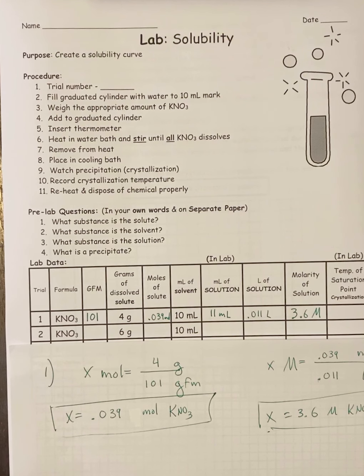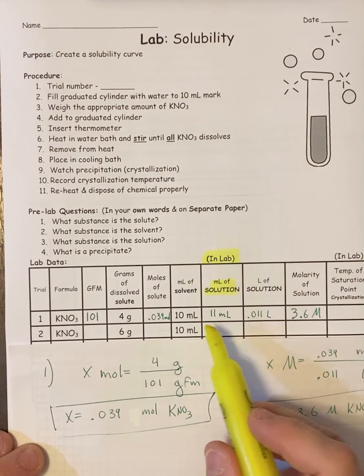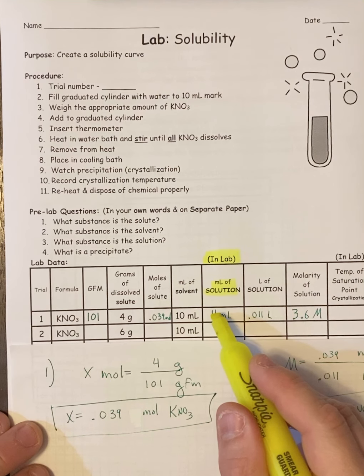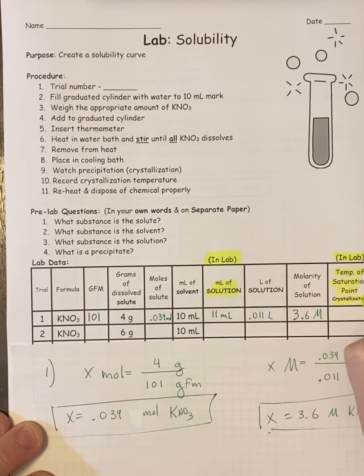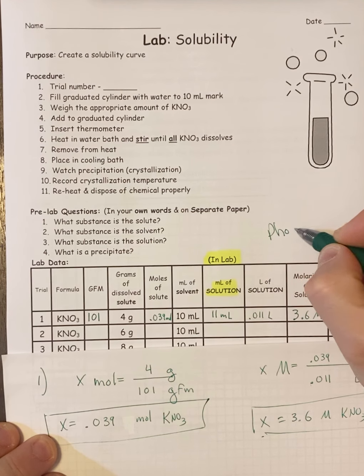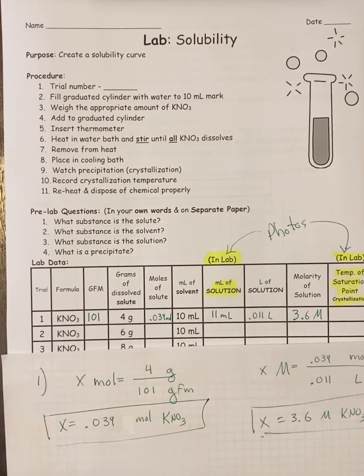All right, and then the last thing that has to be done from the lab is, remember, this part has to be taken directly from the lab once the solution is fully dissolved and with the thermometer not in the solution, because the thermometer will add extra volume, obviously. There'll be pictures of that attached so you can get this reading without the thermometer in. And then you're also going to have to get the temperature at which the material started to come out or precipitate out of solution, which there will be a picture of that attached. So you're going to need this temperature. You're just going to get those from the photos as well. You're going to get this and this from the photos that are attached to the lab, and that is the information that we need to do the second half of the lab.